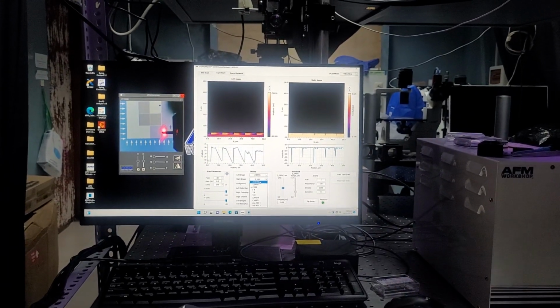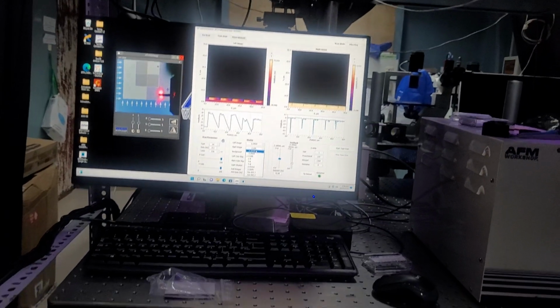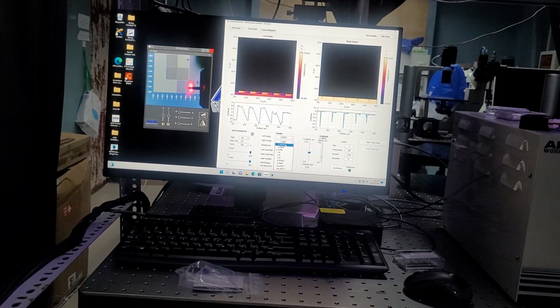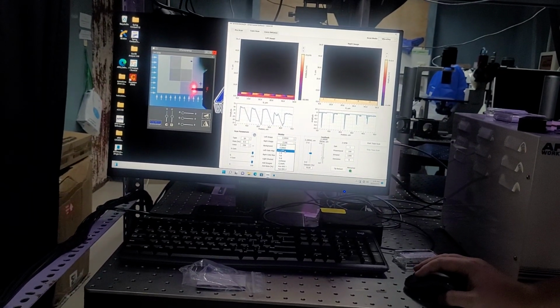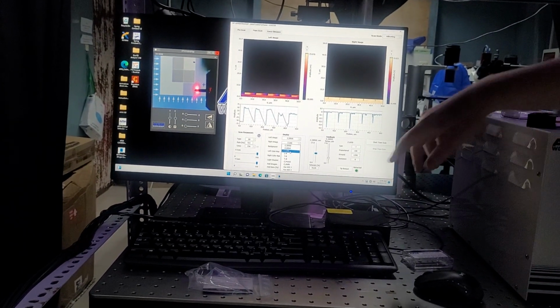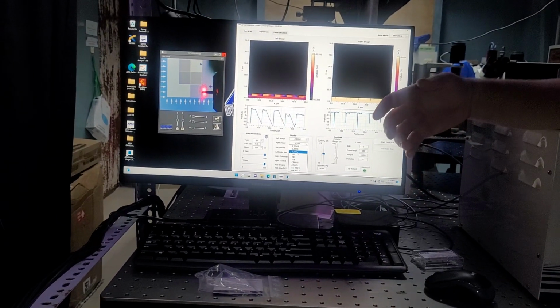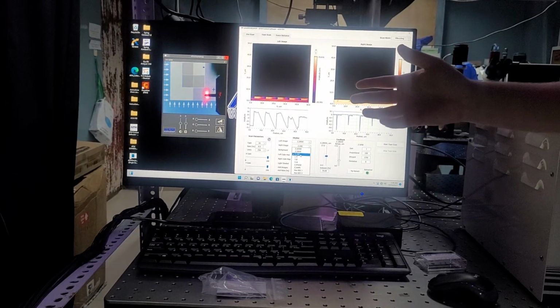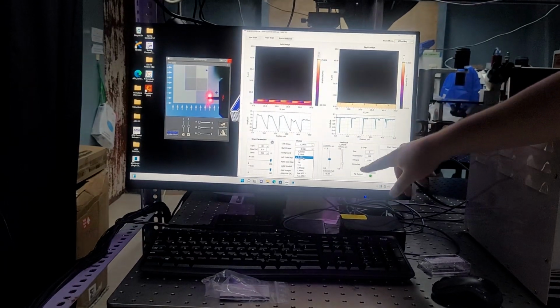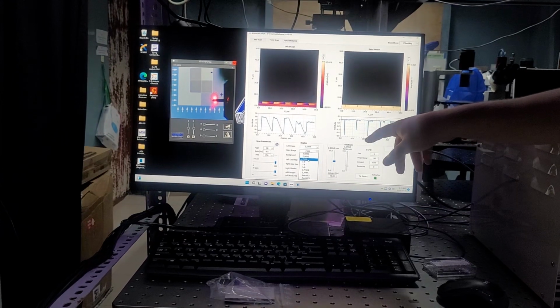You have Z sense, which, as I said before, is a complementary topography technique. It should not replace your Z drive. It should be used in conjunction with your Z drive. We have Z error. This is where you're able to see your error signal. This is very important. You'll use this to adjust your ZGPID values in order to ensure that you've minimized the noise in the system. So you'll use the Z error to adjust your ZGPIDs to make this error signal as small as possible.